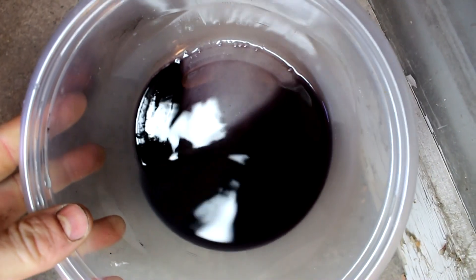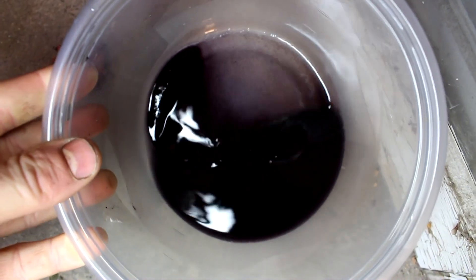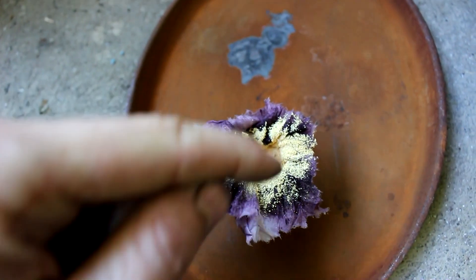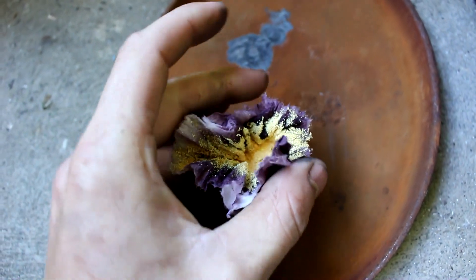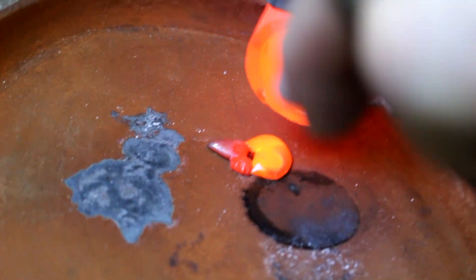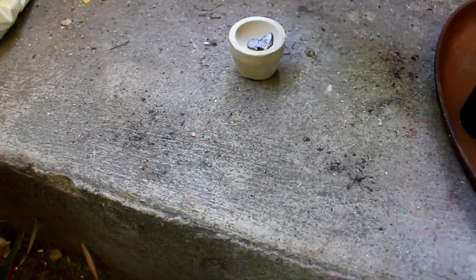The piece of metal is completely dissolved and I still have the black powder, so presumably there's some gold here. I filtered out the gold-containing black powder and added a little bit of litharge flux — the orangish color — to help collect it together, using standard methods of collecting precious metals. We're going to pack that into the crucible, load it in the furnace, and here's the lead and gold mixed together.